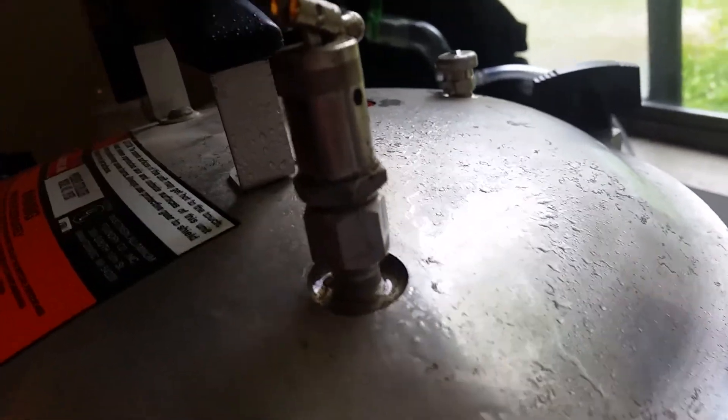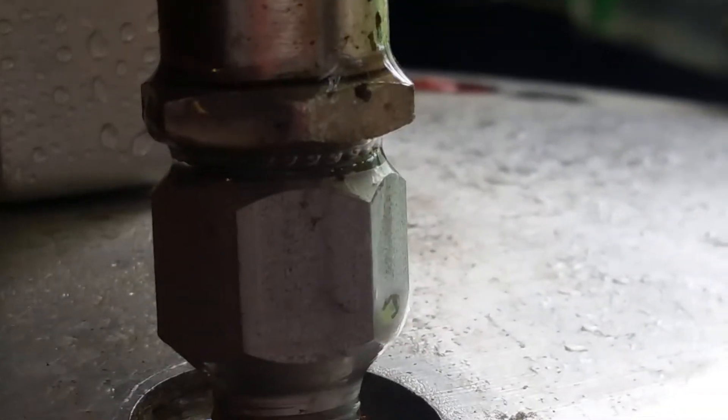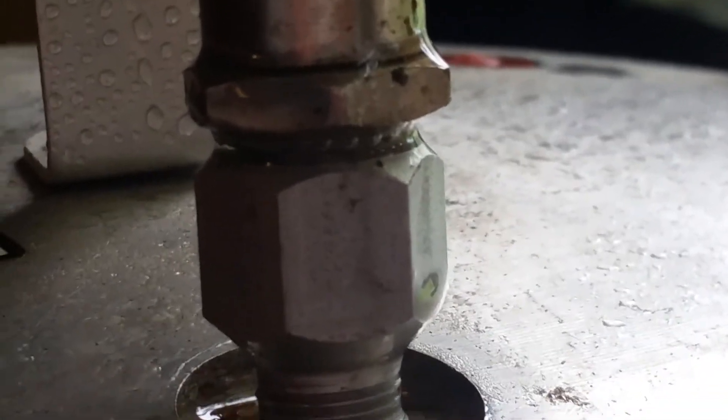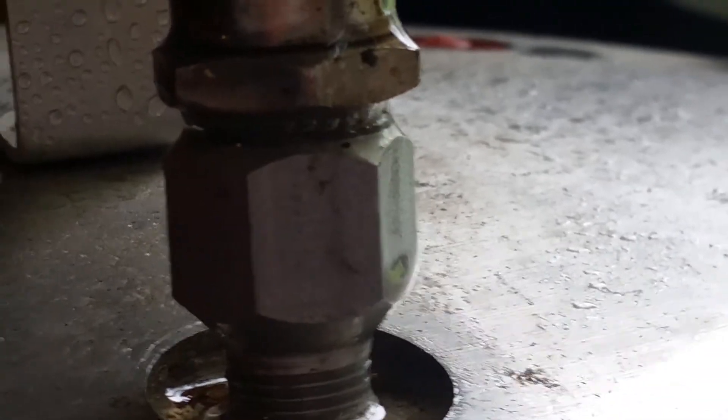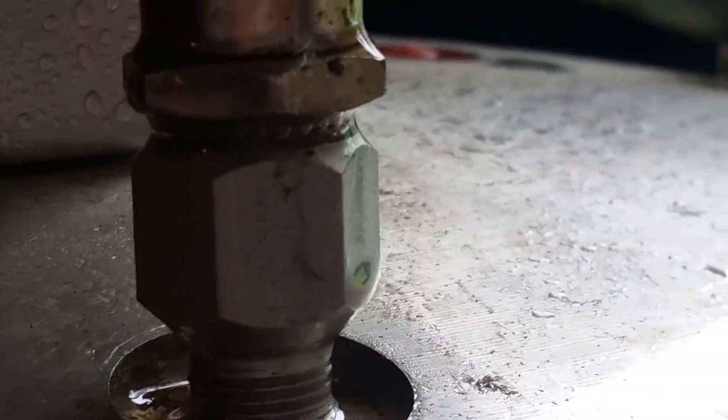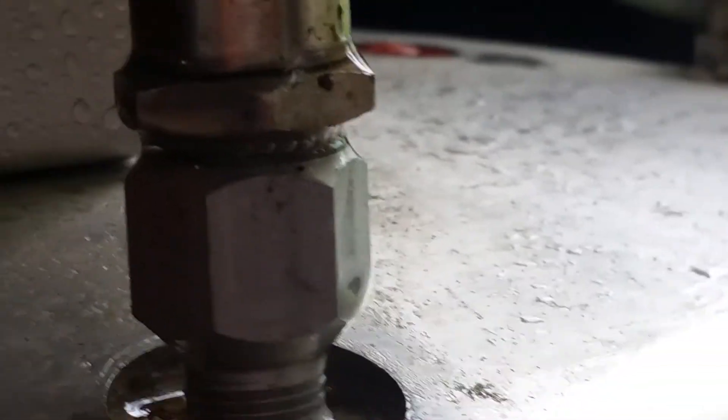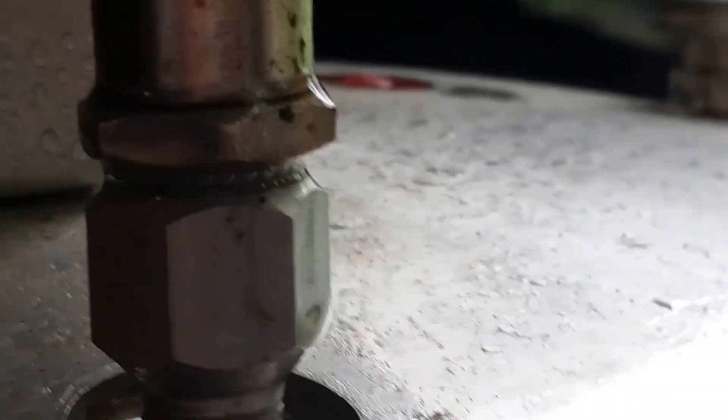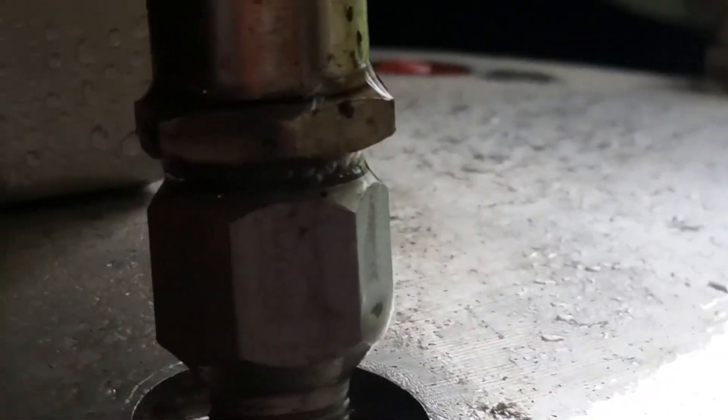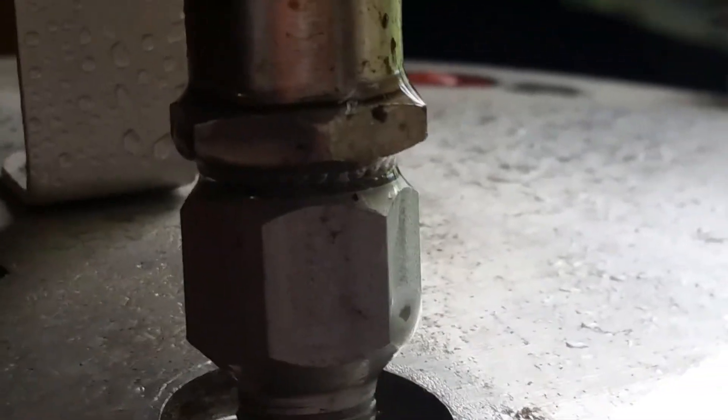Okay, so I sprayed this with water. Let's see if we can get this to focus. I found my bubbles. If I can hold it steady. You can see the bubbles right there. So it's at that thread. I'll probably have to take that apart, throw some Teflon tape in there and tighten it back down. Let's see if that'll fix it.